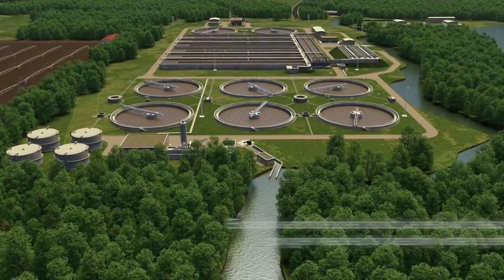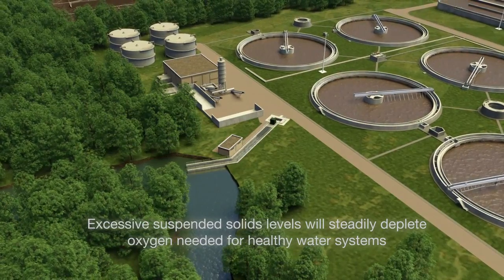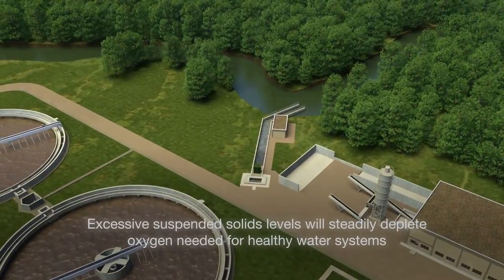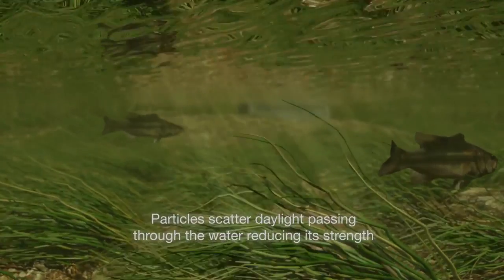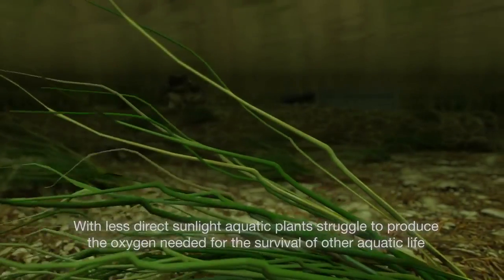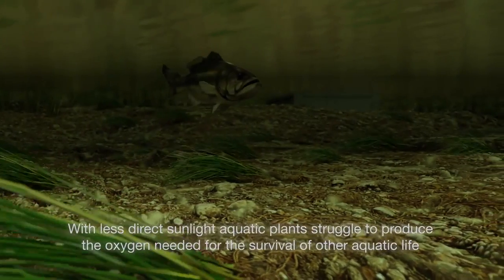In municipal wastewater applications, excessive suspended solids levels can trigger a chain of events that can steadily deplete the level of oxygen in the water needed for a healthy aquatic ecosystem. As particles build up, they scatter the daylight passing through the water, reducing its strength. With less direct light for effective photosynthesis, aquatic plants struggle to produce the oxygen needed for the survival of other aquatic life, including fish, amphibians, and waterborne insects.